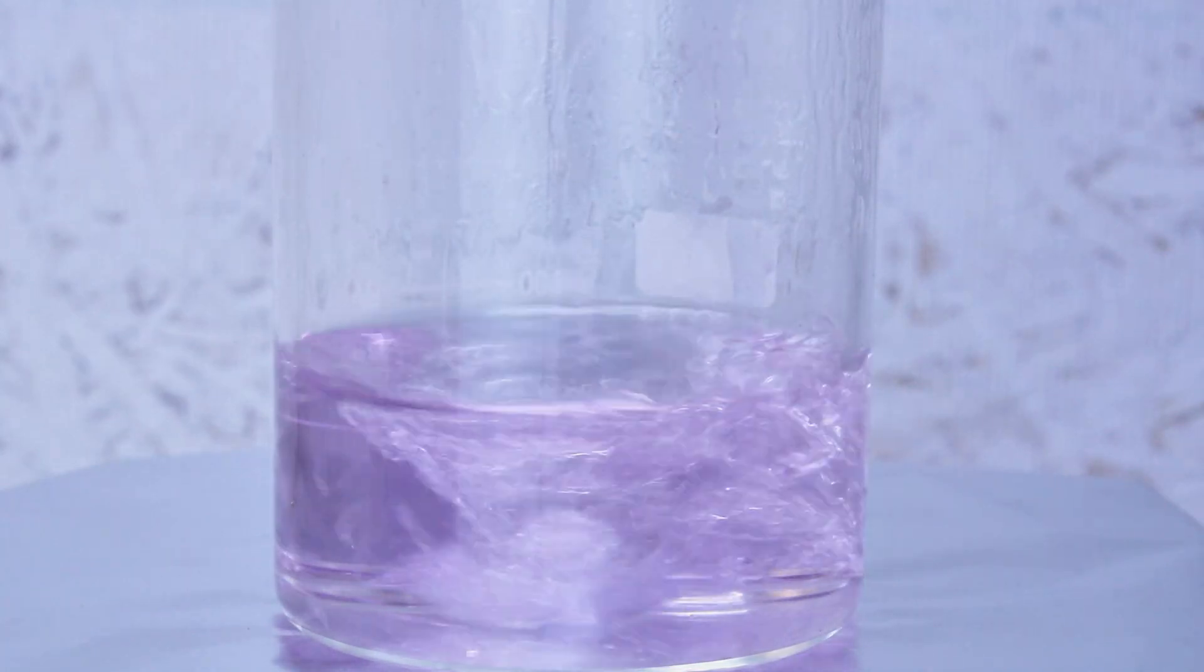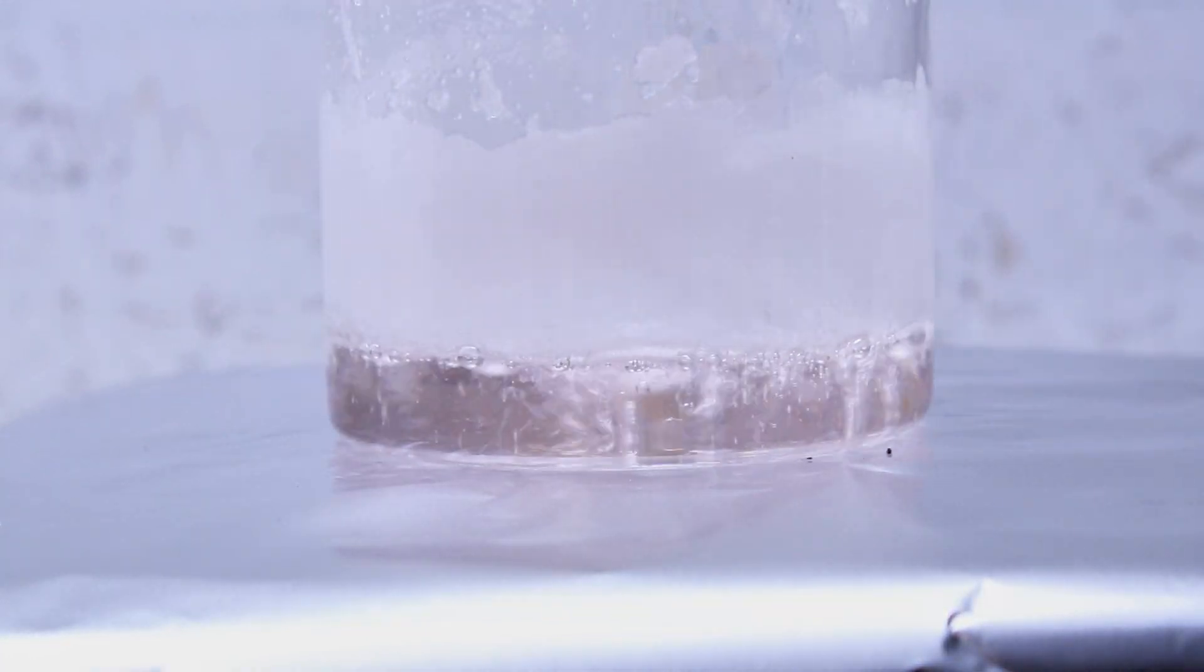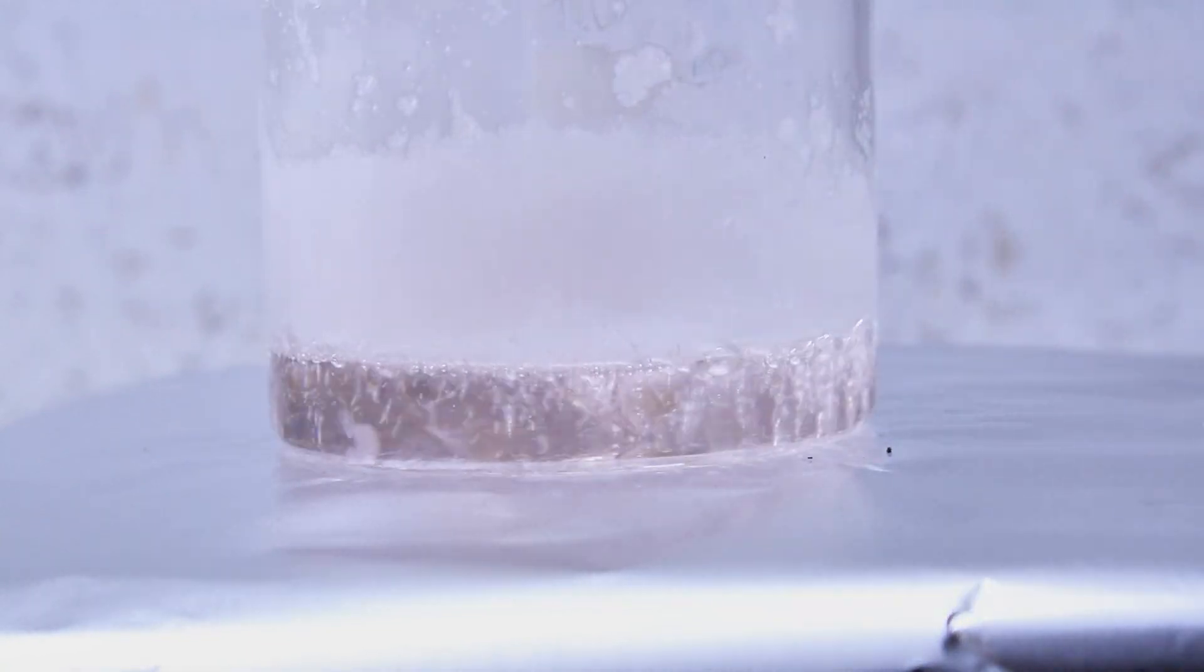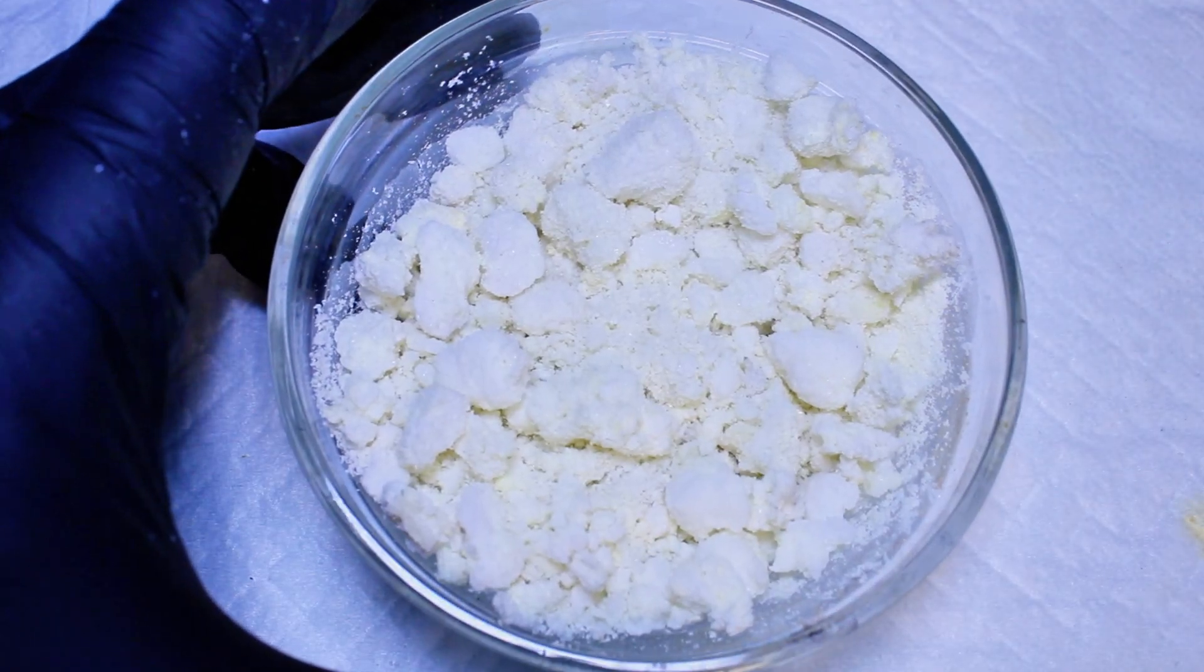Anyway, once all the water had been basically completely boiled away, the beaker was removed from the hot plate and the aniline hydrochloride allowed to crystallize before being transferred to another dish. I somehow lost this footage as I filmed this a fairly long time ago, but it wasn't really very interesting anyway.